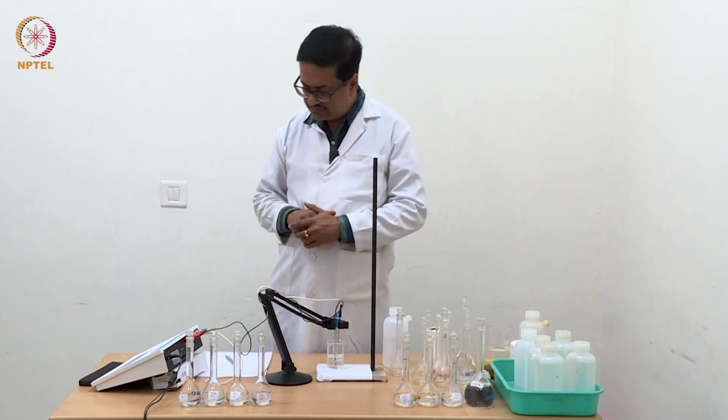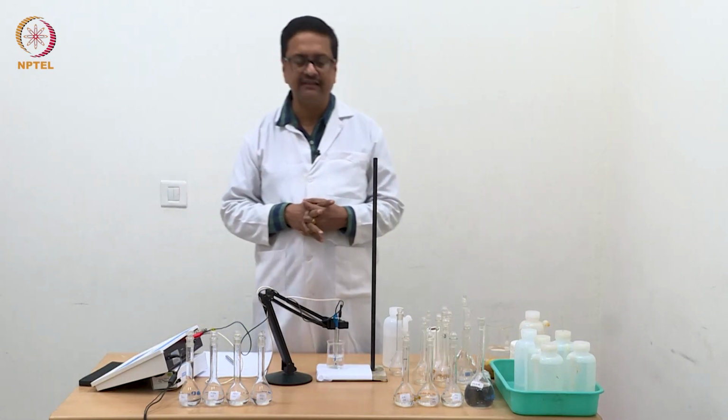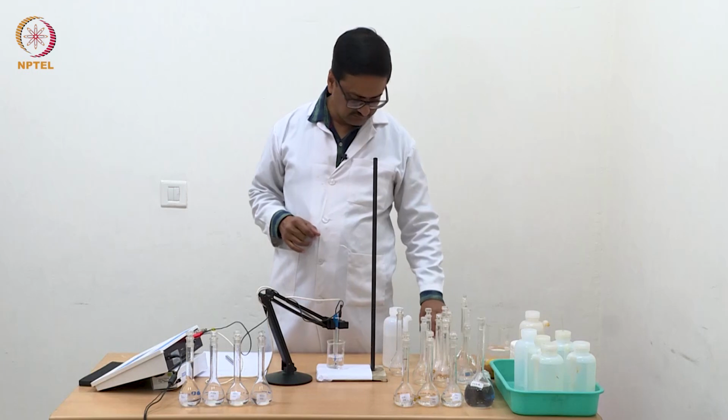So with N by 16, the reading is 28.56, 28.57, like that.